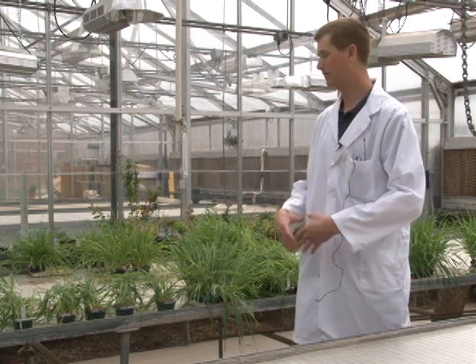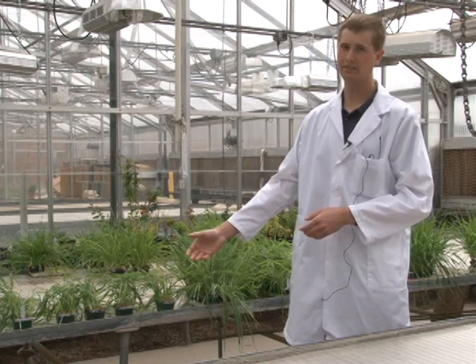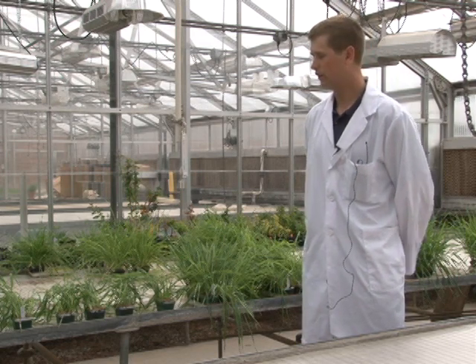Hi, my name is Matt Rouse, and I'm going to demonstrate the methods of race analysis used by scientists at the Cereal Disease Laboratory in St. Paul, Minnesota in the United States. Our hope in this demonstration is that you will be able to analyze races of stem rust. The specific techniques and methods I'm going to demonstrate are unique to our lab. Depending on where you are, you might modify these techniques to fit your resources and environment. But the overall concepts and processes for race analysis are the same no matter where you are.